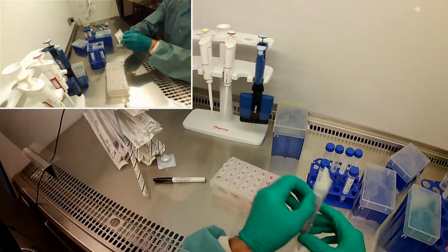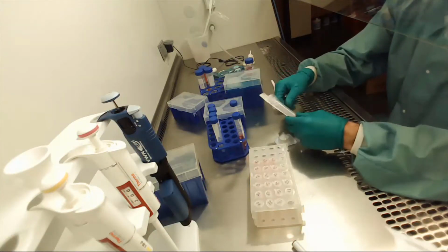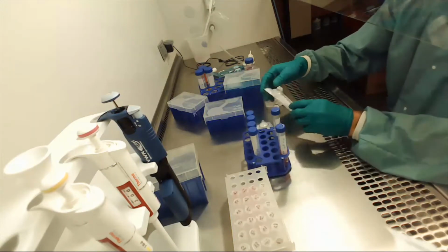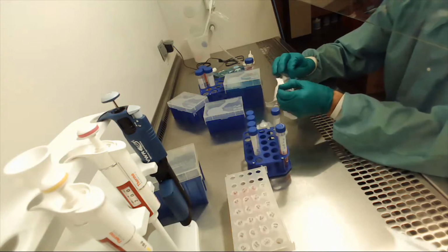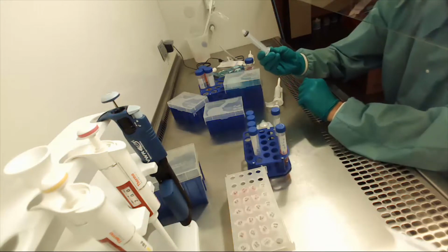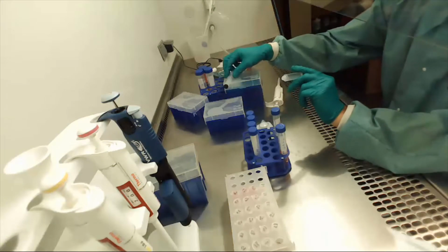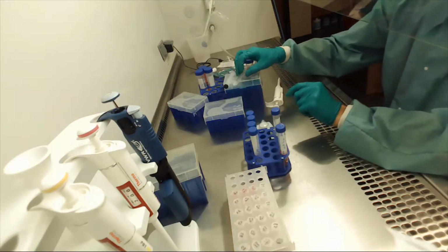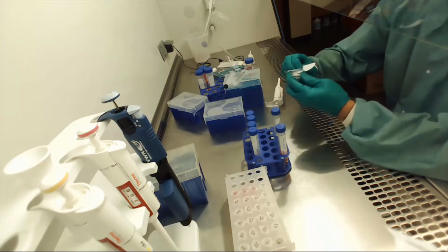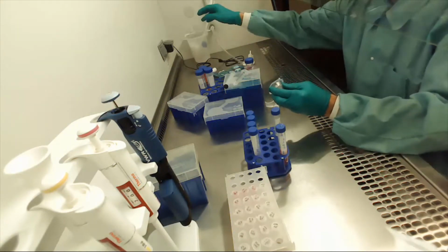The easiest way is just to use a sterile filter that's on the syringe. And so this is, again, a little bit tricky to get right, but it's really important if you want to sterilize something inside the biological safety cabinet. Right? And so actually, we don't care much about keeping this thing sterile. Like the inside there is sterile, but we're not going to end up keeping it that way. That's not our concern. Our concern is it's got to pass through the sterile filter. And so the outlet of that sterile filter is what we really need to be careful about keeping sterile.